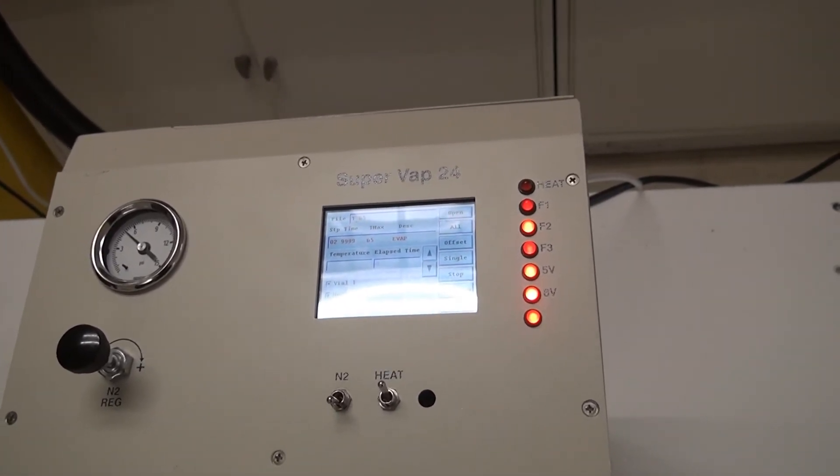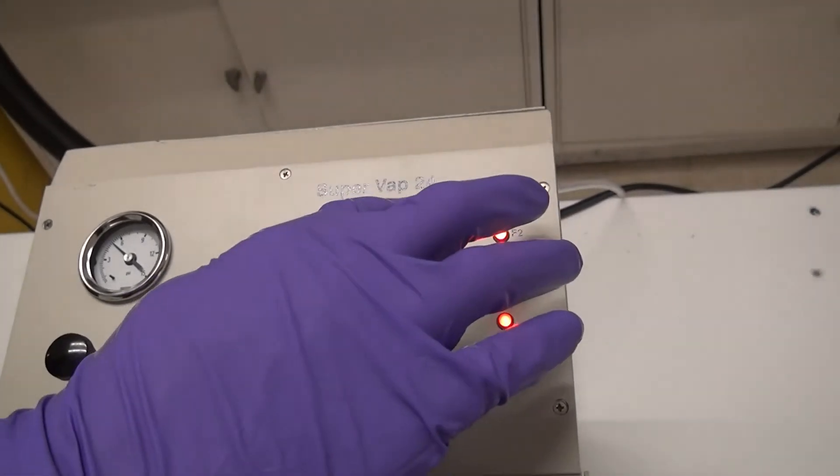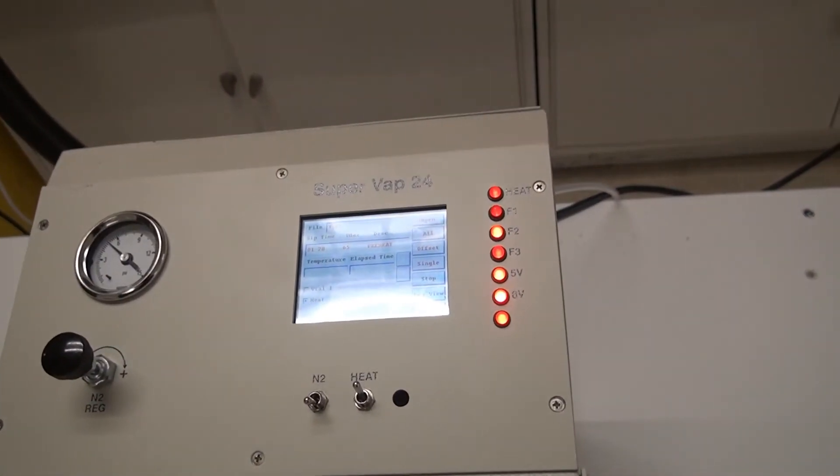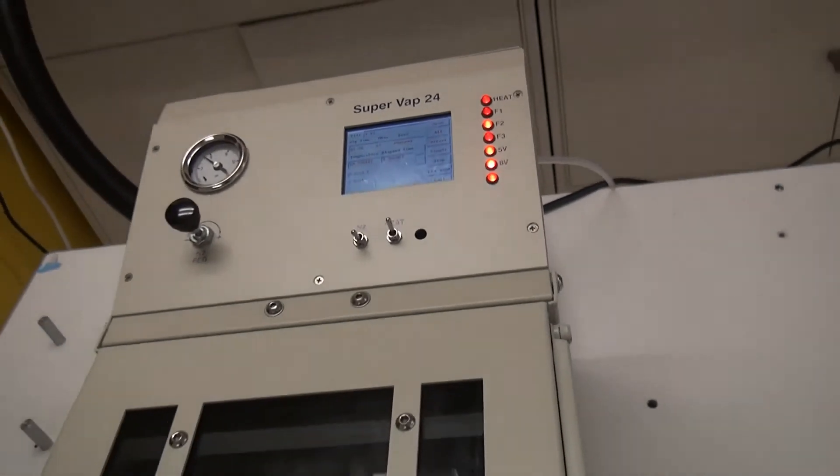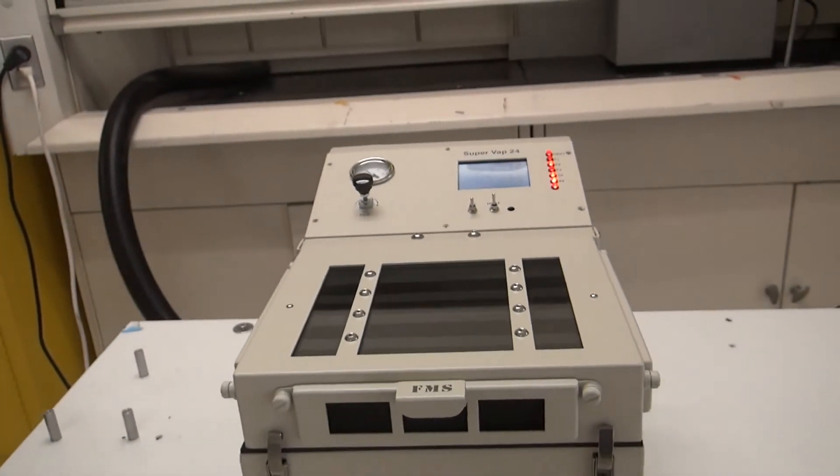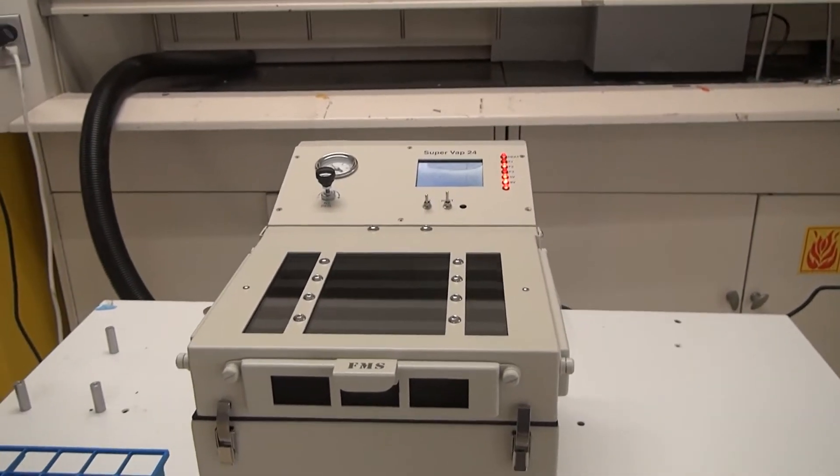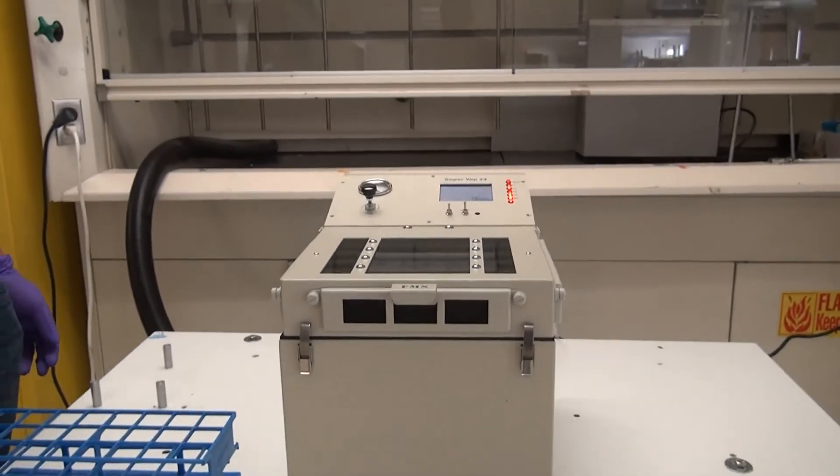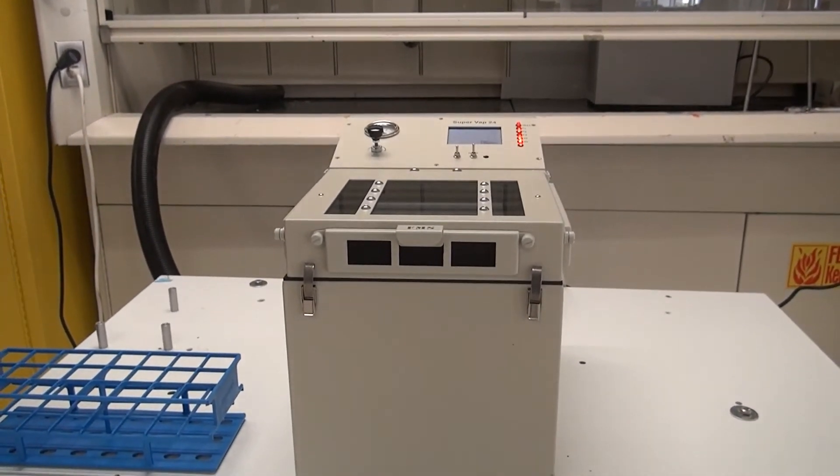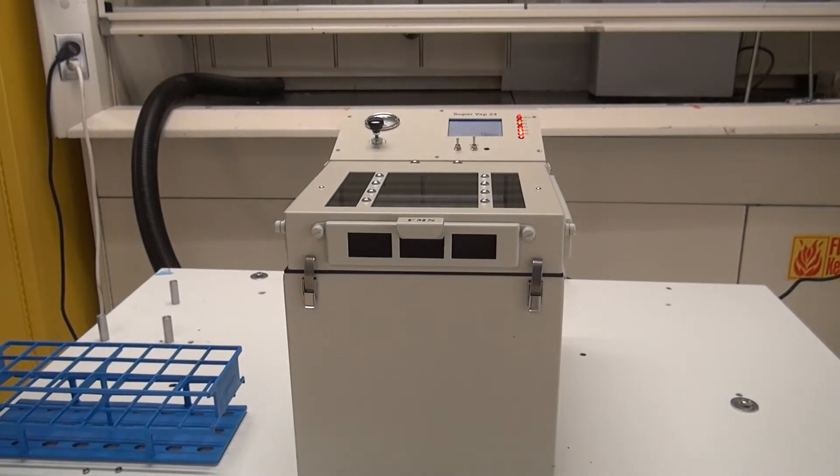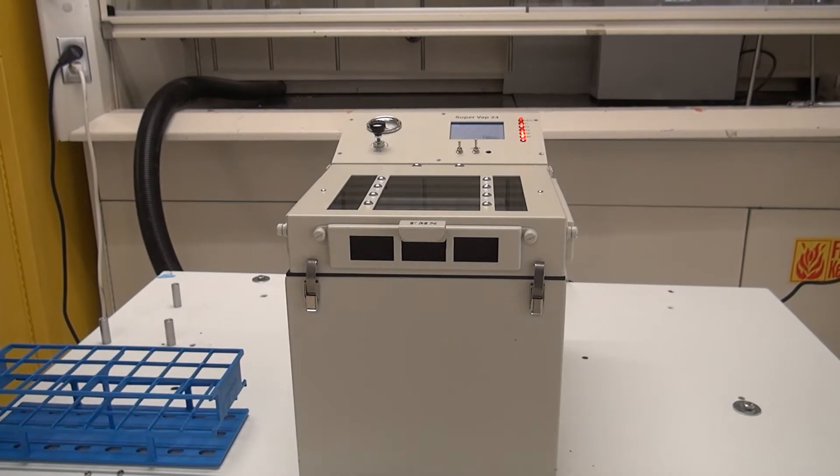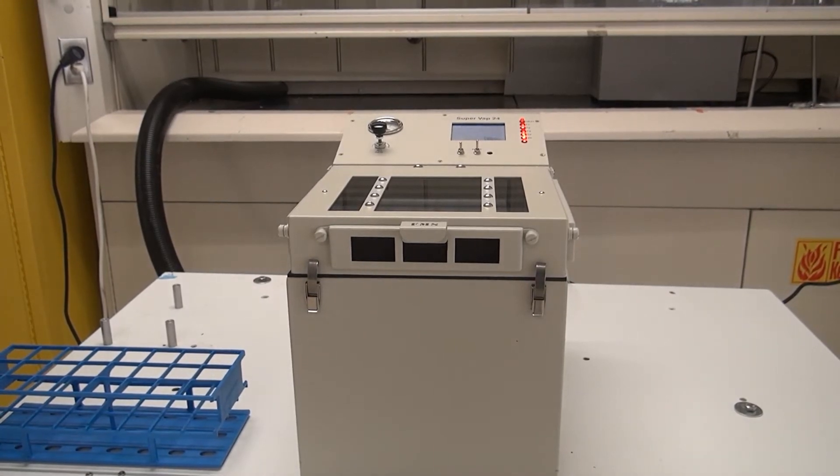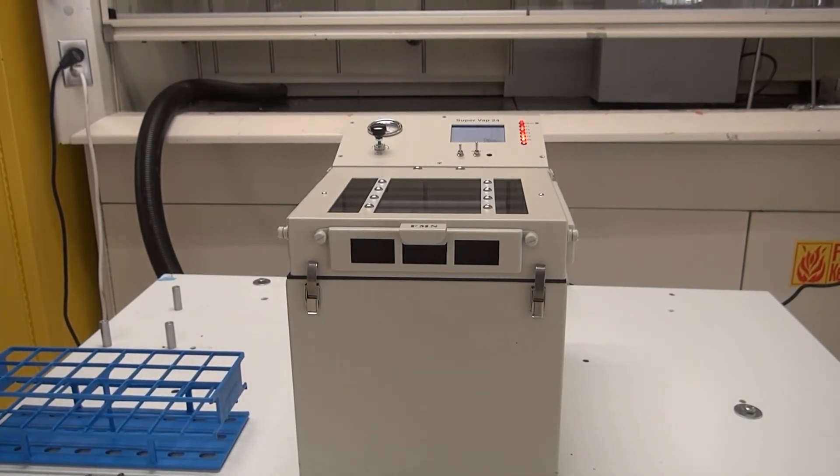We're going to hit the all button and that's going to start the process. So you just saw the heater light come on. There's a five psi nitrogen stream now hitting these vessels and we have the timer set to around, I should correct myself, 55 minutes.